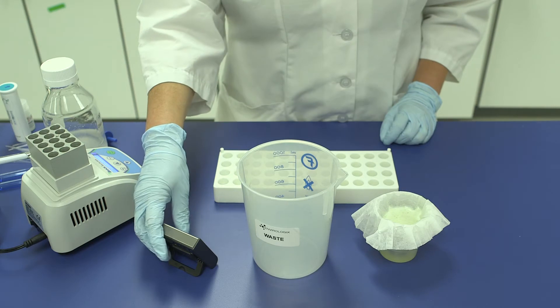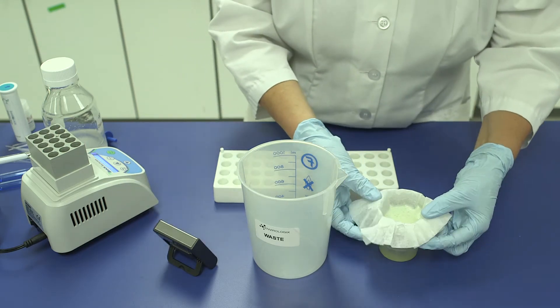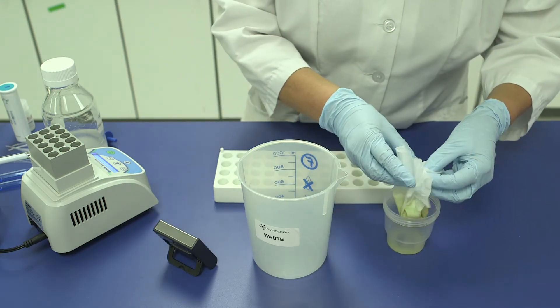Also, if clarifying the sample using the filter method, remove and discard the filter after 2 minutes.